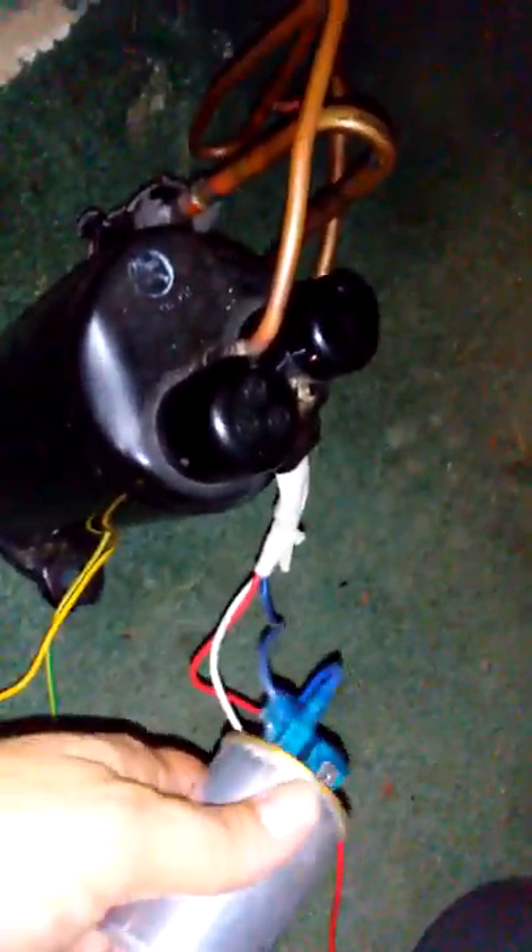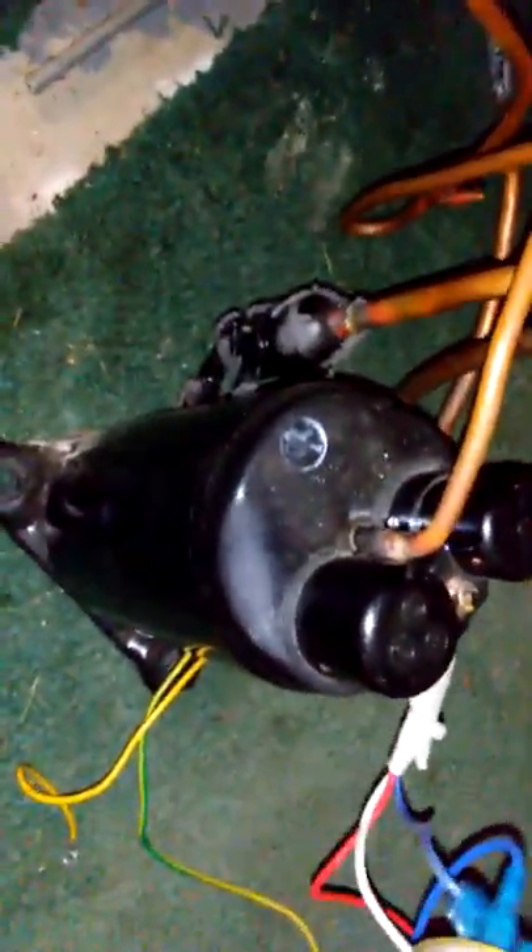The only thing is I think I'm going to put it in the bucket — mount all this up out of the way so it's not near water — and then submerge this thing in either ice cold water or mineral oil to cool it off. Because right now I could probably cook an egg on it, it's ripping hot. Other than that, it's working perfectly, better than I thought.